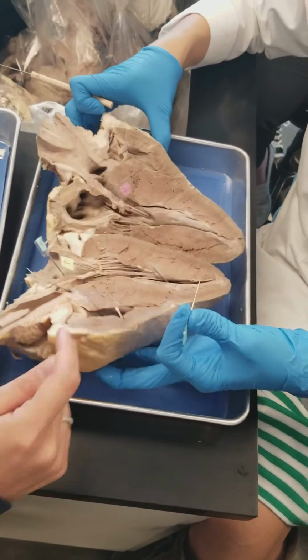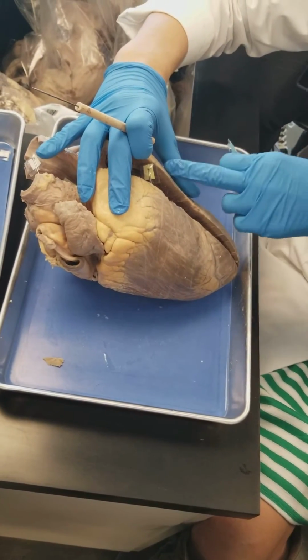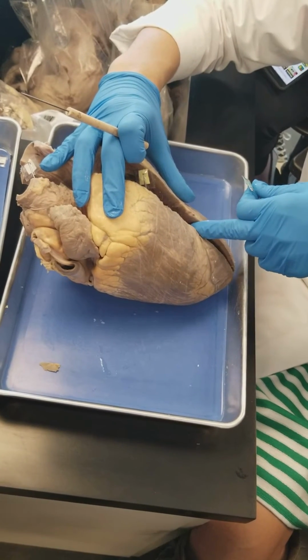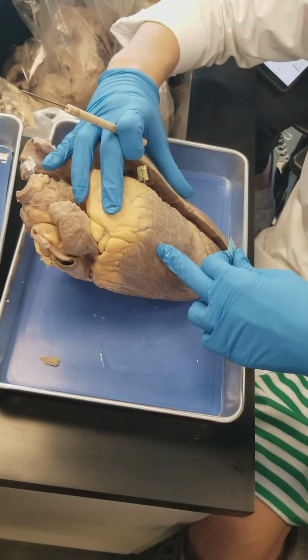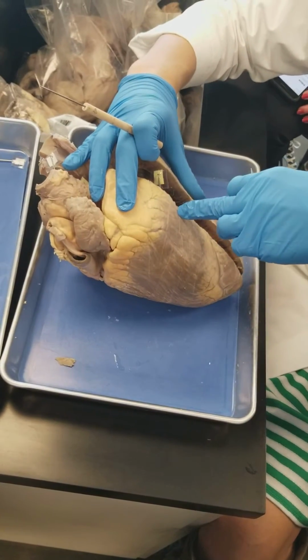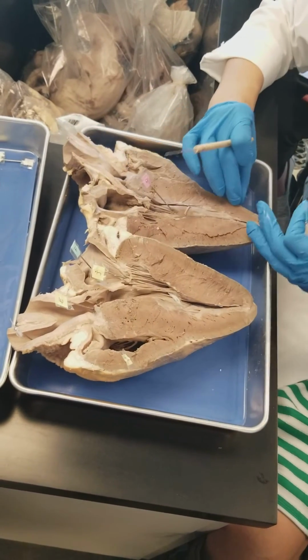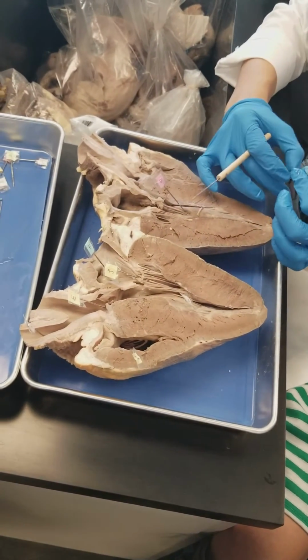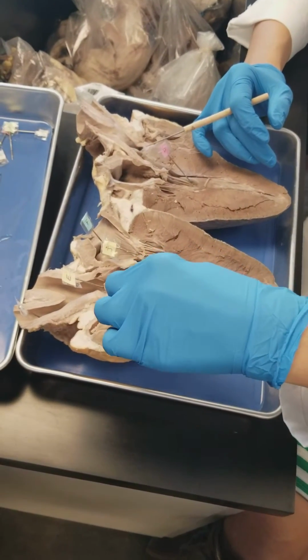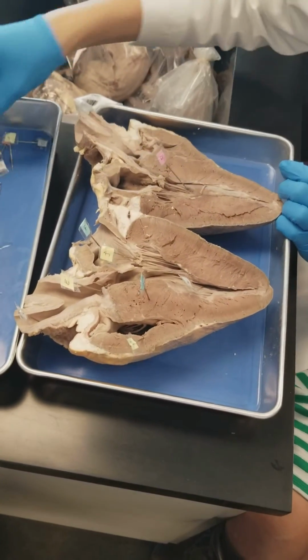And that's the tricuspid. Because when you close it, this is the apex. This is the left anterior descending artery, right? And inside here is the left ventricle, and up here is the right ventricle. And the right ventricle spans all of that. The right ventricle is on top, but it's not at the apex. It's above the apex. So letter B is right ventricle. And then this would be the interventricular septum.